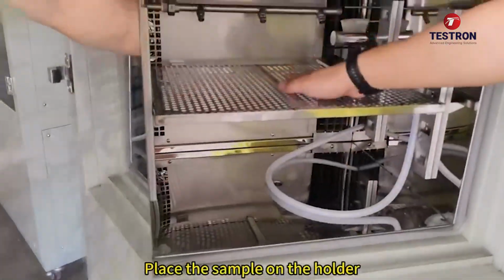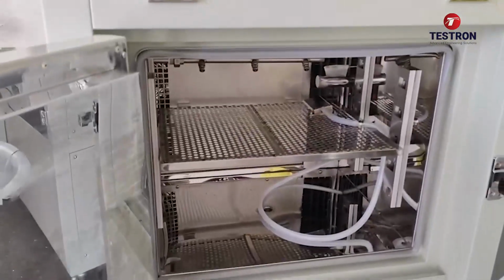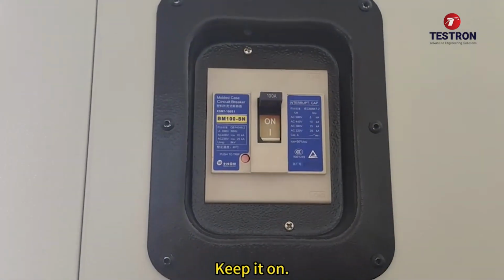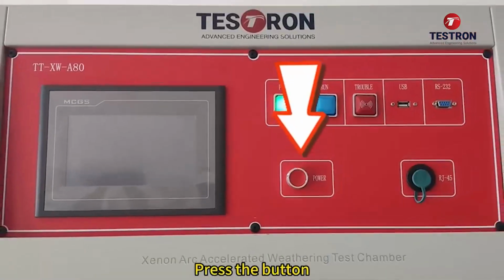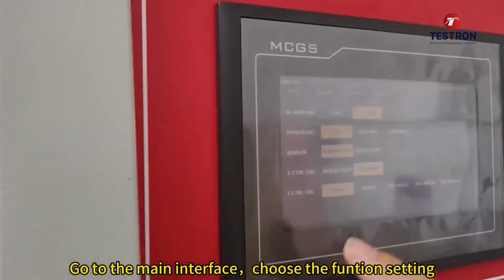Place the sample on the holder. Keep it on. Press the button. Go to the main interface and choose the function settings.